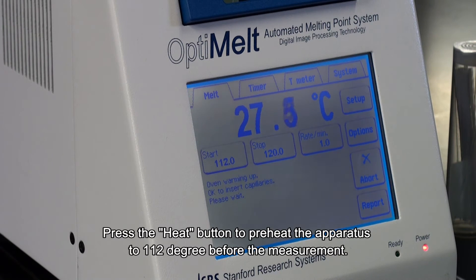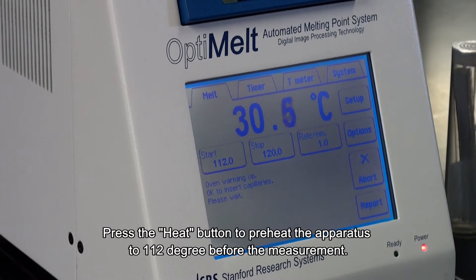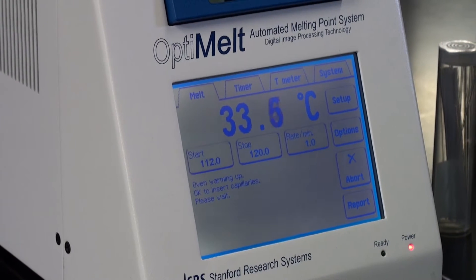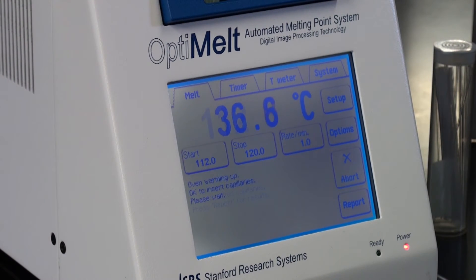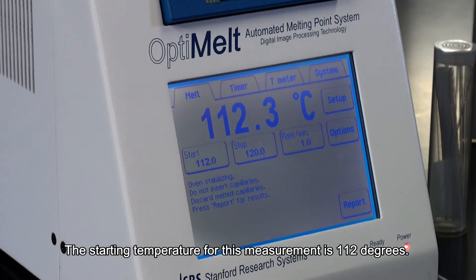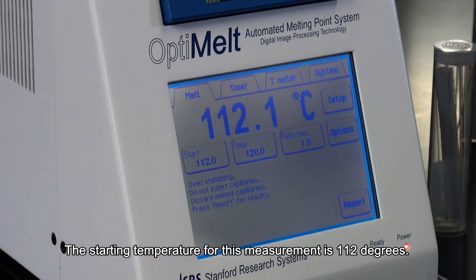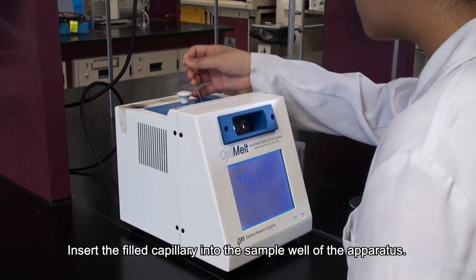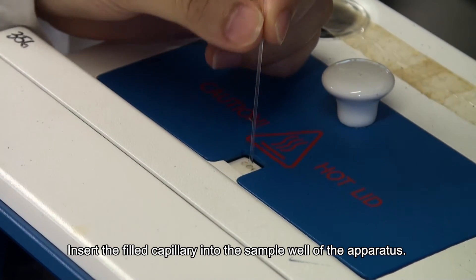Press the heat button to preheat the apparatus to 112 degrees before the measurement. The starting temperature for this measurement is 112 degrees. Insert the filled capillary into the sample well of the apparatus.